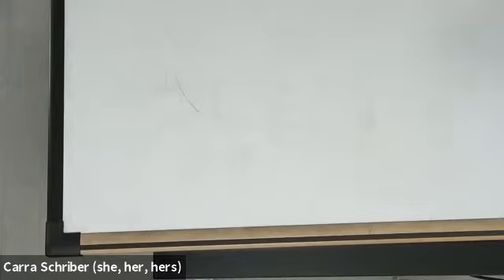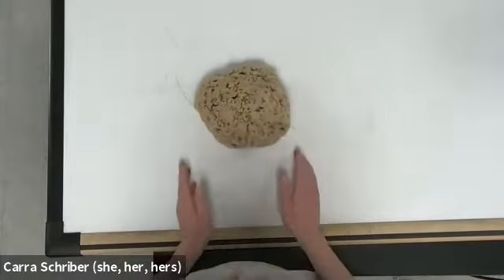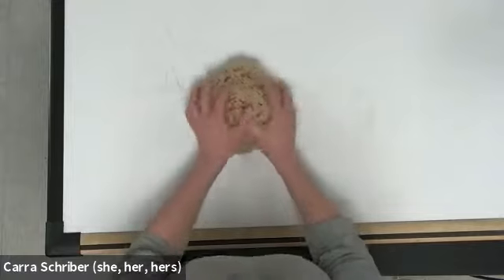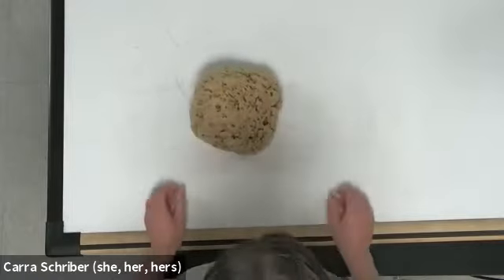Okay, so we're starting with phylum Porifera. And this is a parazoan, which means that it has no true tissue types. And you're probably familiar with this. This is just squish, squish, squish, like a regular commercial sponge, right? Soft, has some nice spongy texture feel to it, all right?